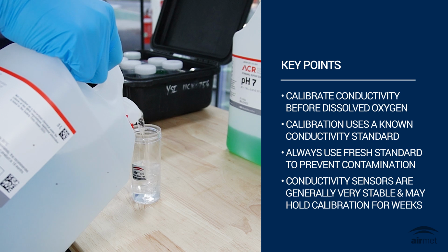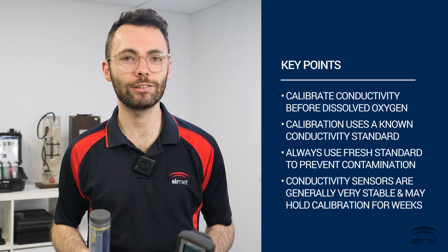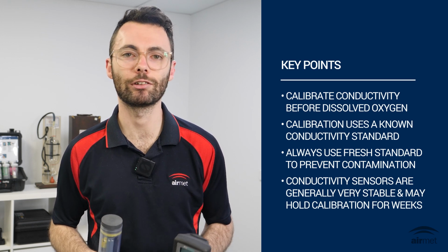Conductivity sensors are generally very stable and may hold calibration for weeks. Best practice is to verify daily with a known standard and to recalibrate if verification is outside your defined tolerances.